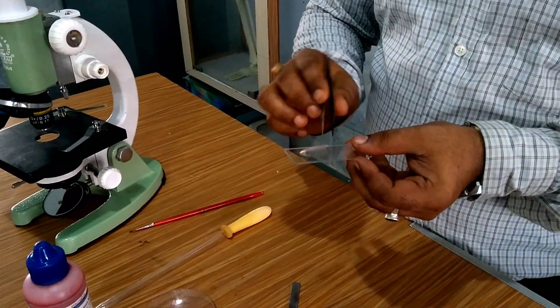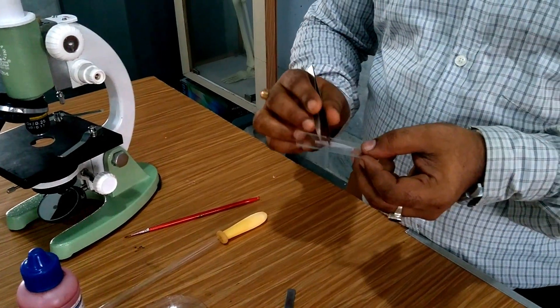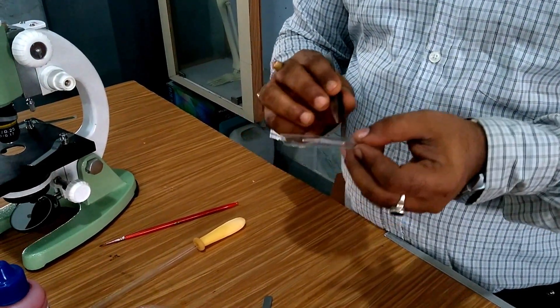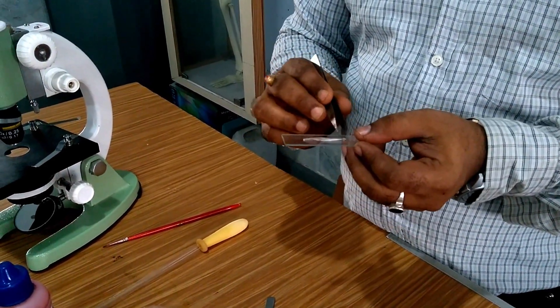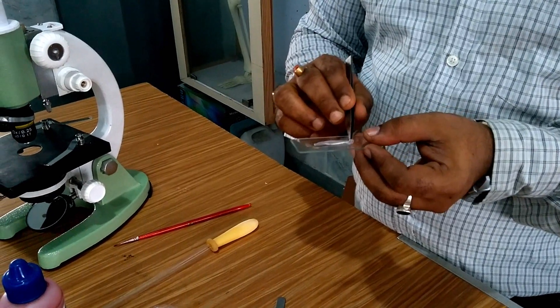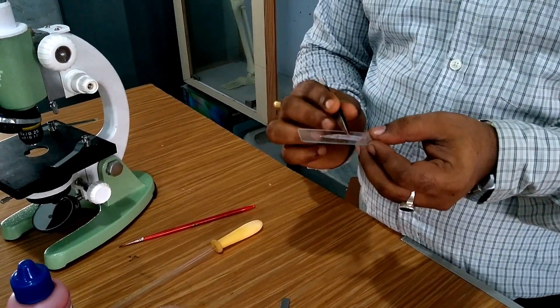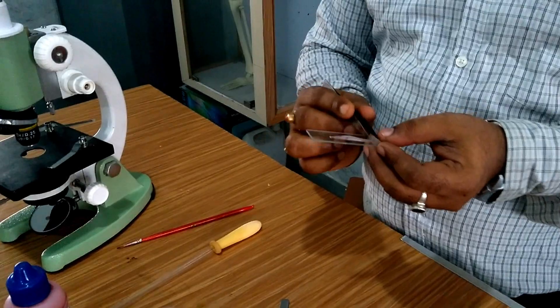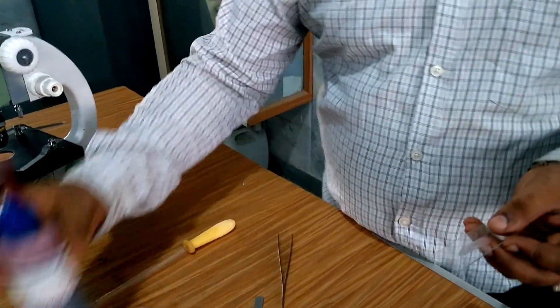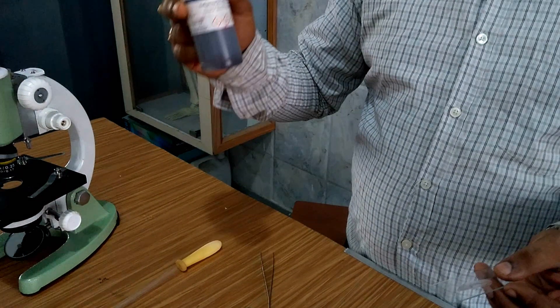Just take it into the slide. You can use iodine even — sometimes iodine solution is also used to observe cells of Allium cepa. But here I will use only the safranin, which is used only in plant cells.